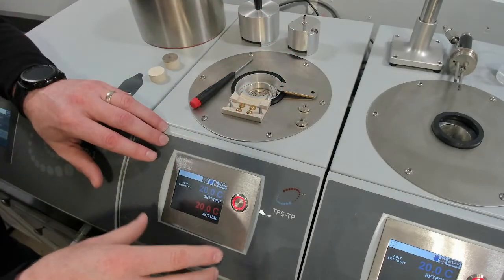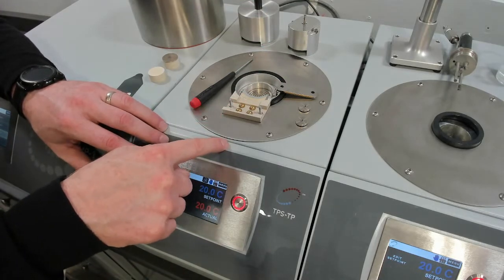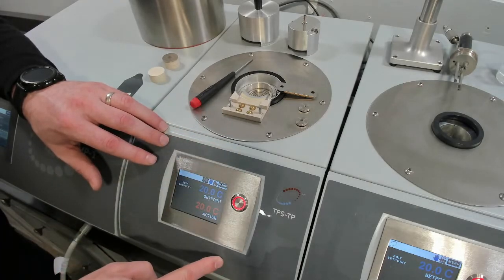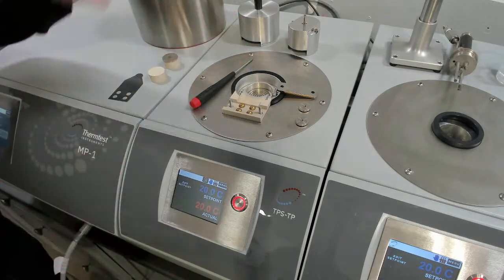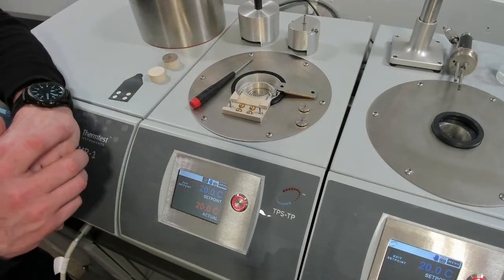And if you want to go colder than 0 degrees, we have different cooling options. So there is a minus 45 degrees Celsius cooling option and a minus 160 cooling option. And those work in concert with the design of the temperature platform to offer that full range without having to remove the sensor and move it to different temperature devices.